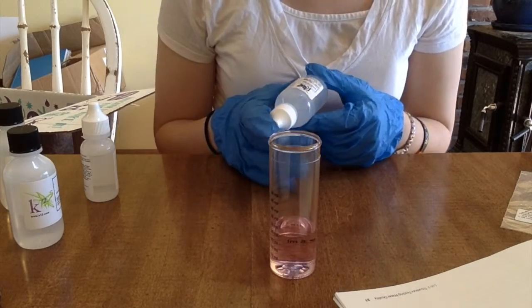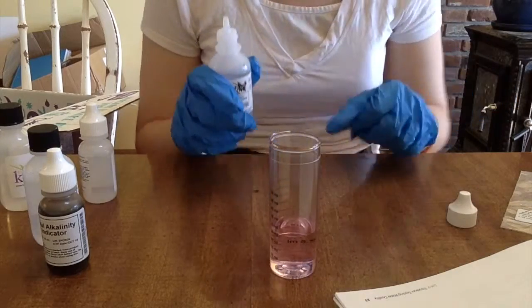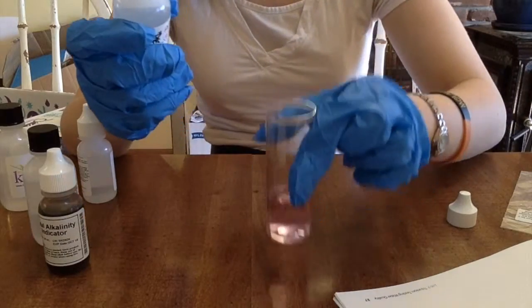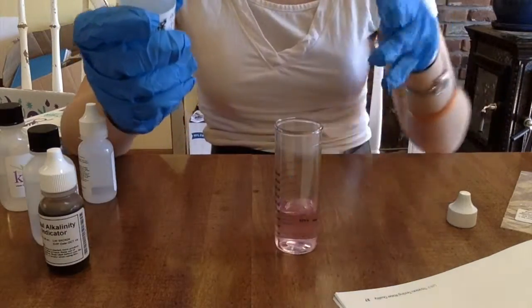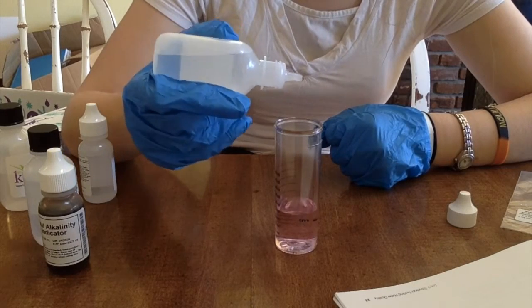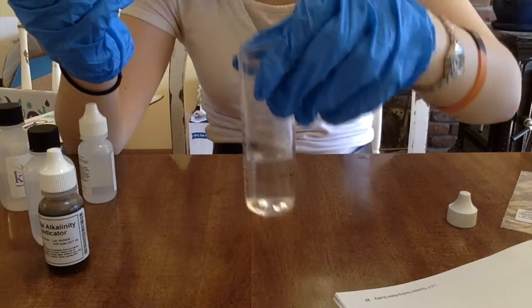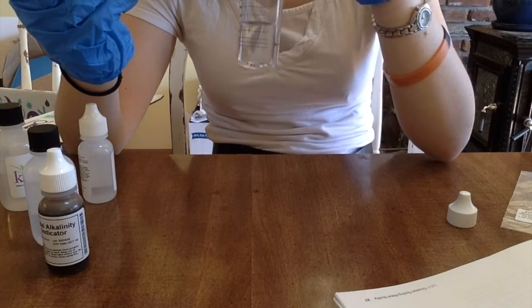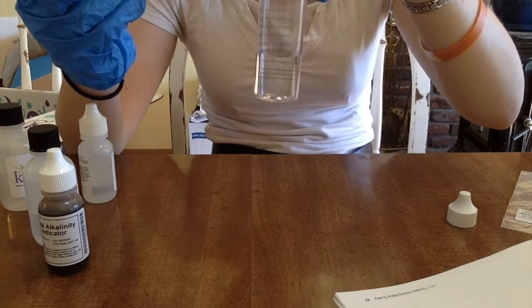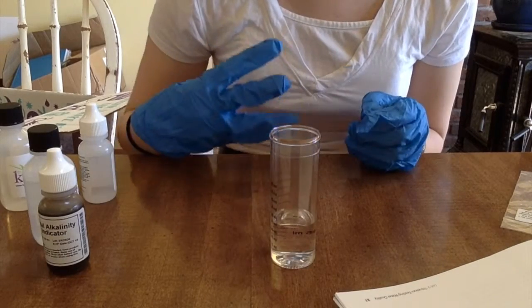The next step is using this sulfuric acid, which is the alkalinity titrant low, and adding drops until the color changes completely from red to colorless. I added kind of a lot. Count the drops: one, two, three, four. And swirl. Wow, that's like completely clear. That's completely clear. That was four. Gotta write that down. That's four drops for P alkalinity.